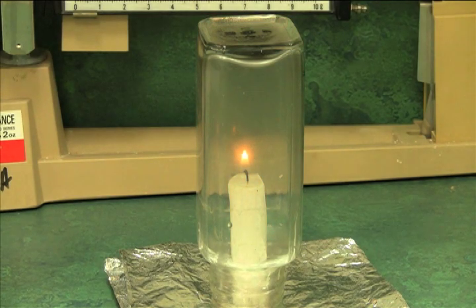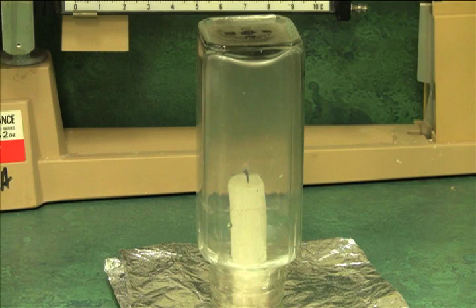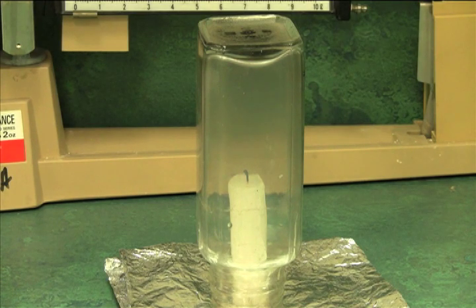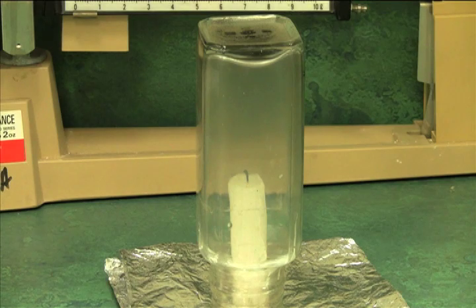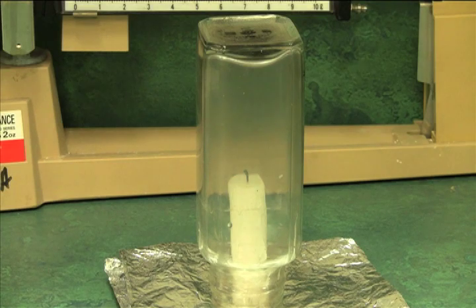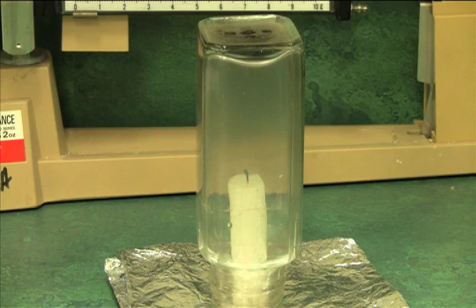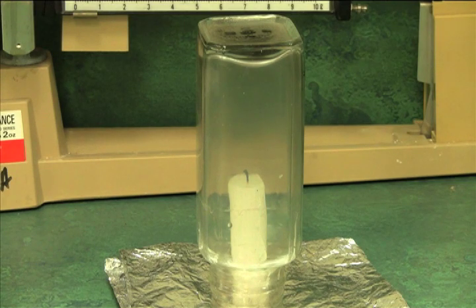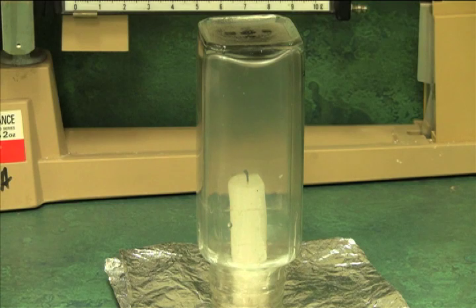My timer is running. And the flame just went out in exactly eight seconds. So write down your observation of what that flame did, but also what the candle wick did, and the jar. For example, I noticed that there was a slight puff of smoke came off the candle wick at the end. And also the jar seems to be kind of foggy inside. You may pause the video to write down your observations on step five, and to write down your time on step six.